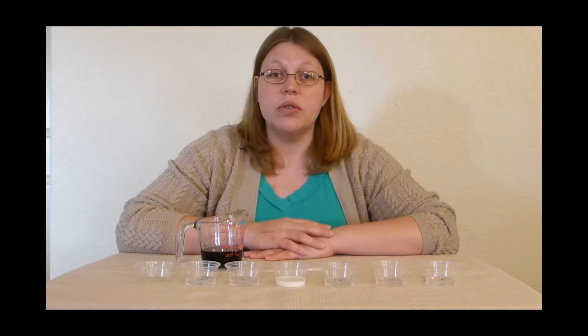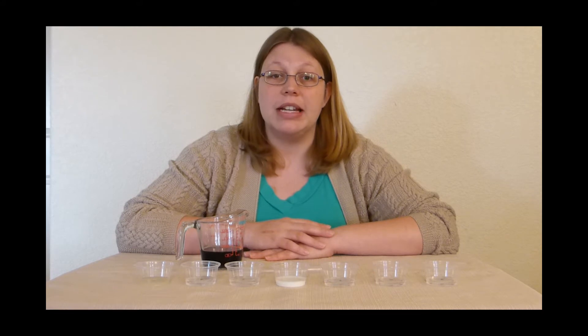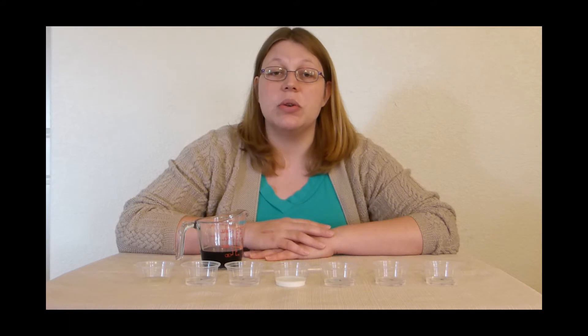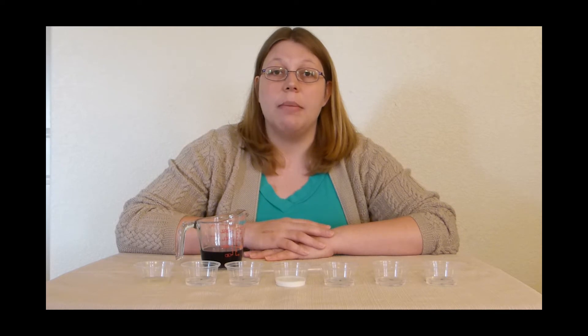The juice of a red cabbage is a natural pH indicator. It is purplish in color normally. It turns red under acidic conditions, and it turns to a blue-green color under alkaline conditions. For this lab, we will be using red cabbage indicator to determine the pH of several common household liquids.